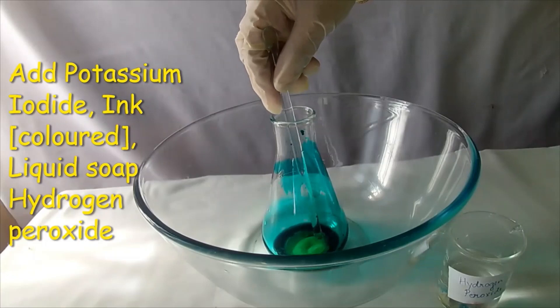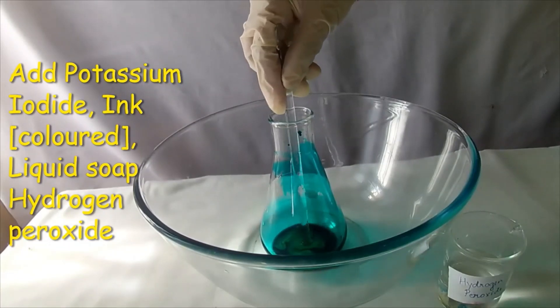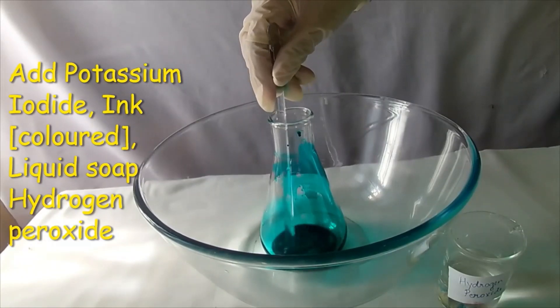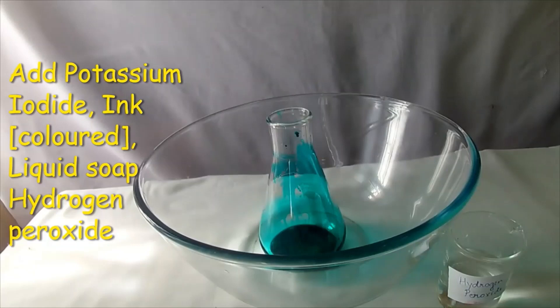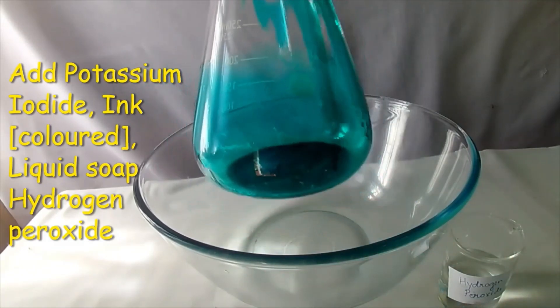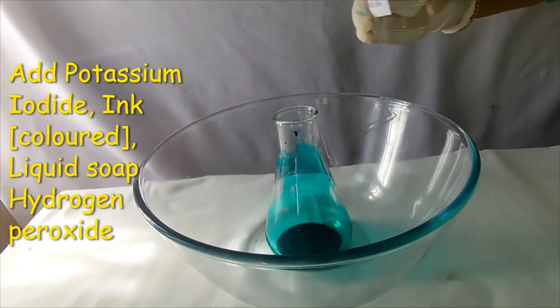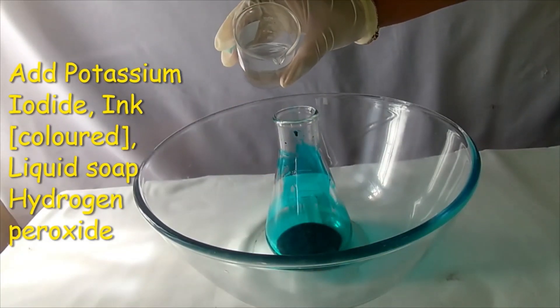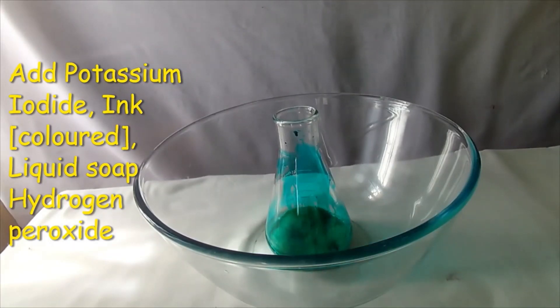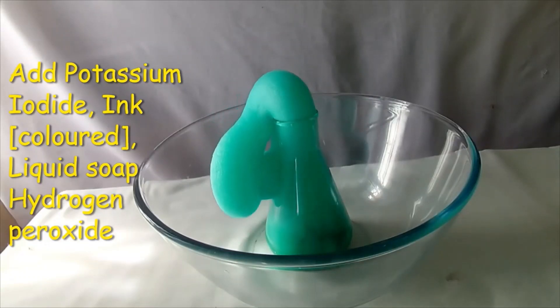Mix it well. Now, add hydrogen peroxide into the conical flask. Enjoy the formation of foam — it is like a volcano!